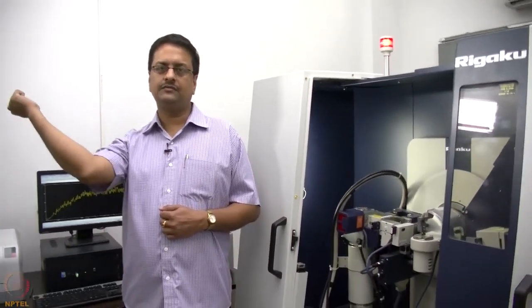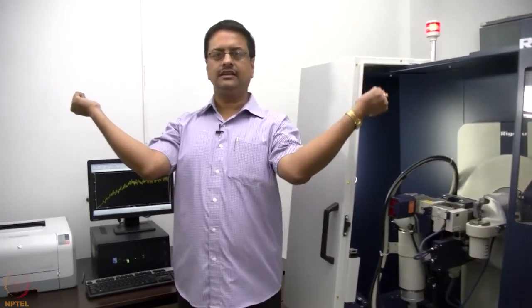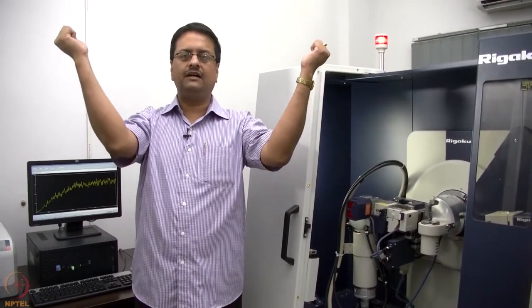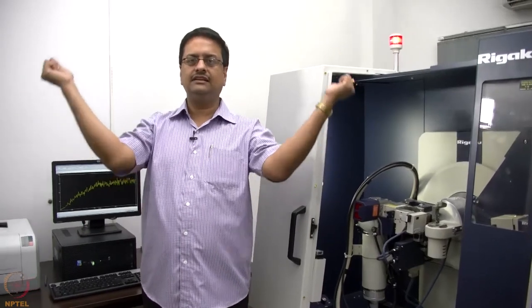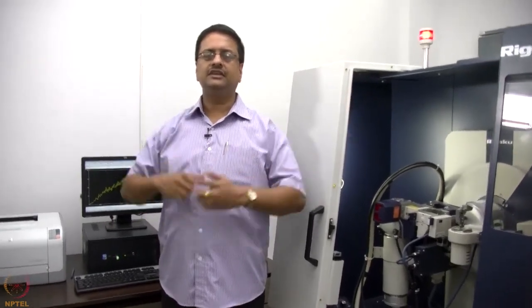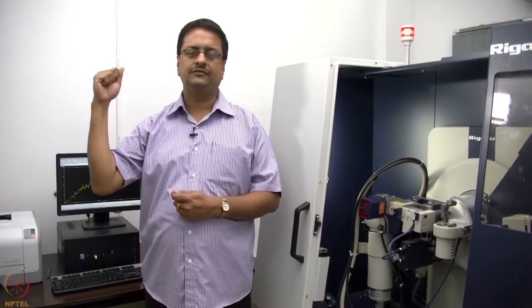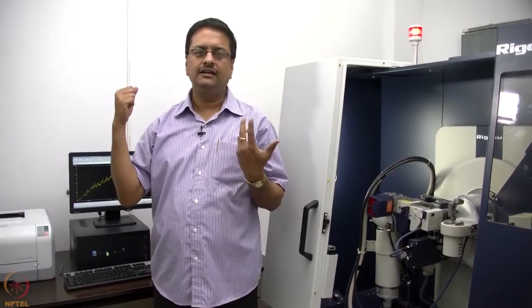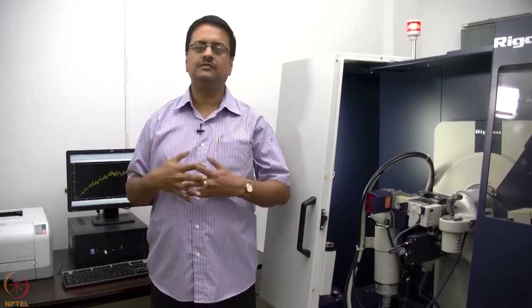I have the X-ray beam coming from my right hand side and the detector on my left hand side, and during the measurement both the detector and the source go up slowly. So this is called the theta theta geometry. The other geometry that is possible is a theta 2 theta geometry, where the source is kept fixed, and both the sample and the detector move upwards. That is a different geometry possible for powder X-ray diffraction measurement.